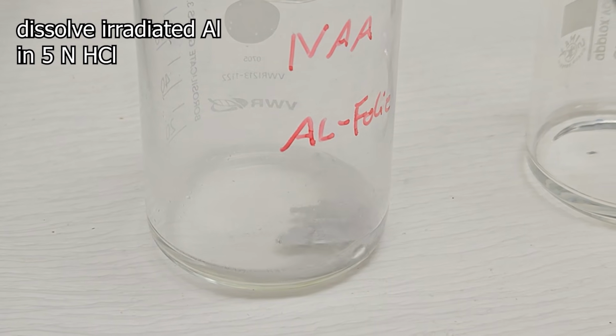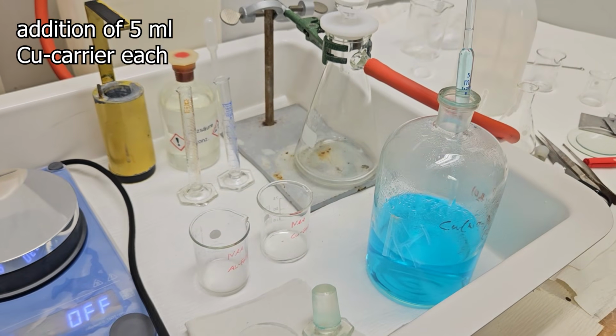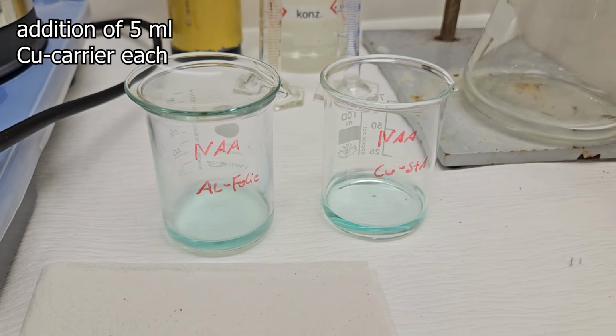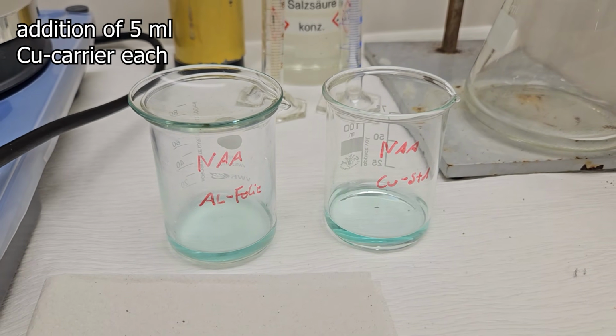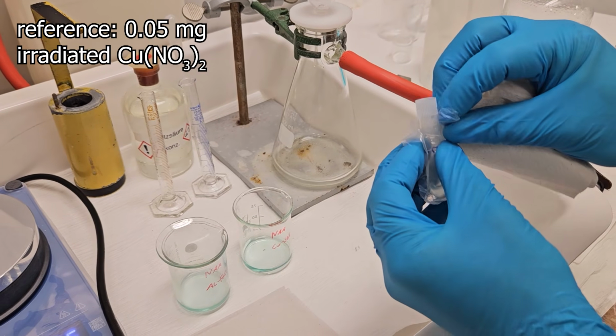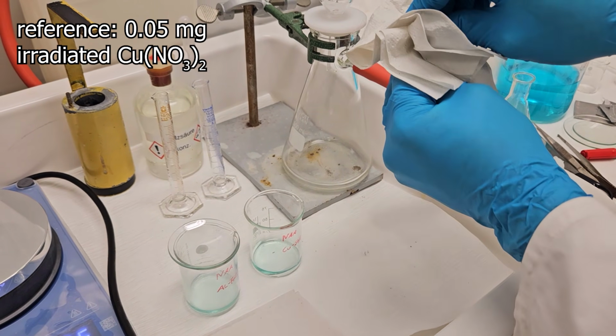Please treat the copper standard in the exact same way as the aluminium foil sample from start all the way to finish. Now add 5 ml of the copper carrier solution. As pretty much always with radioactive isotopes, a carrier is needed as we are dealing here with traces of radioactive copper ions that would otherwise not precipitate as thiocyanate.